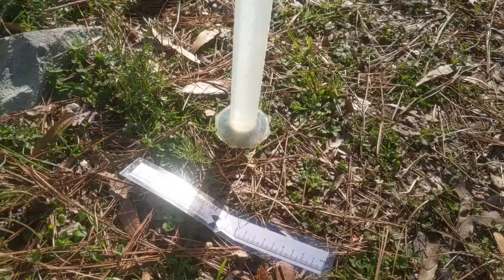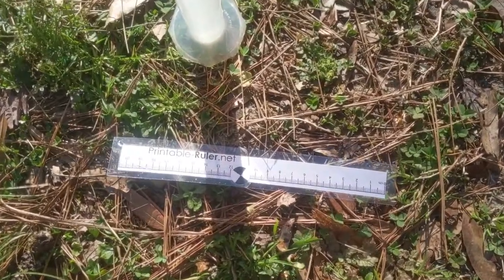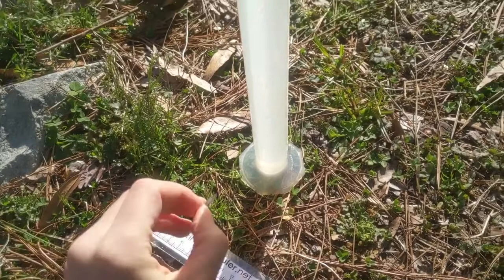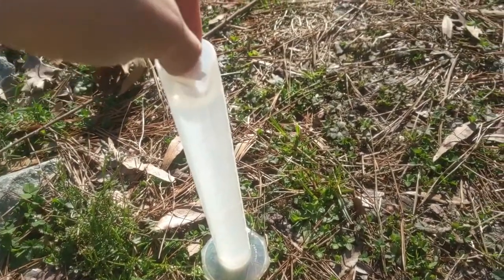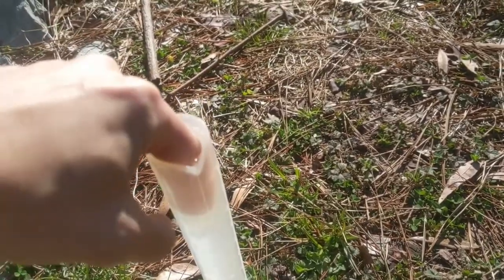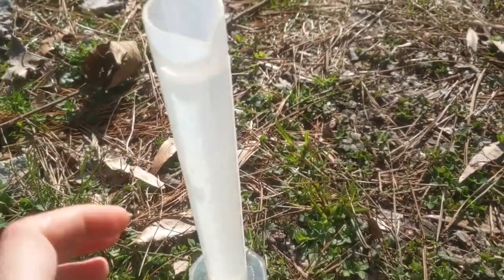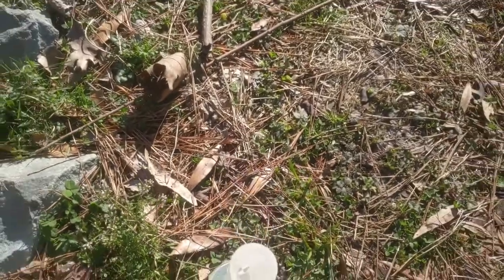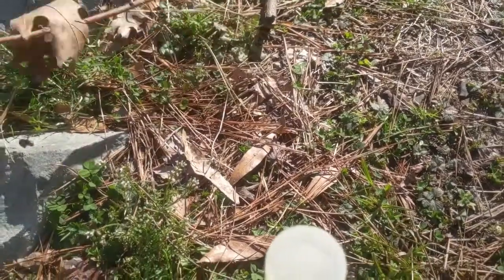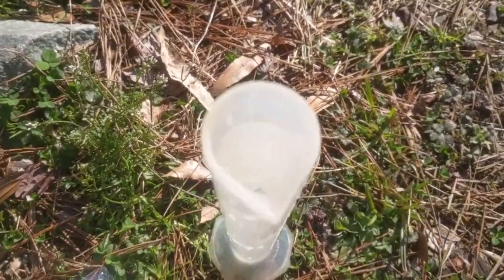All right. Also, while you're out in the field, you're going to measure turbidity. So you're going to want to find this little Secchi disc in your kit, and you're going to drop that down in your graduated cylinder. You can do this before or after you add the water. It doesn't really matter. I dropped mine in after I added water, so I had to use a stick to get it to land on the bottom so that the black and white part was facing up, and it was actually sitting on the bottom.